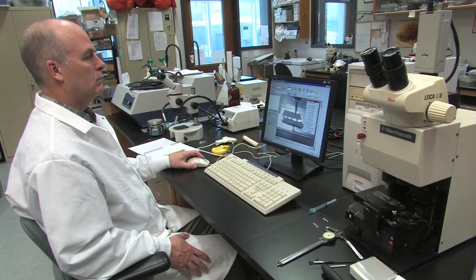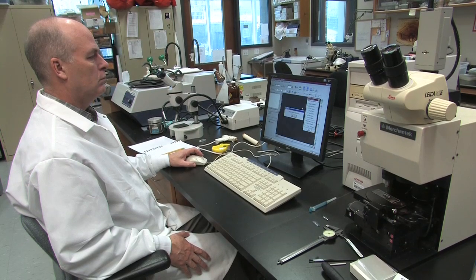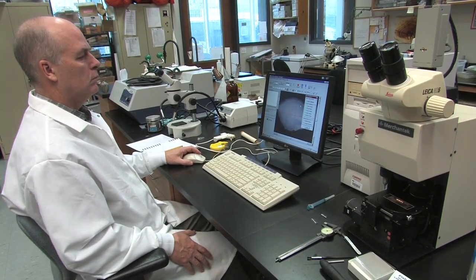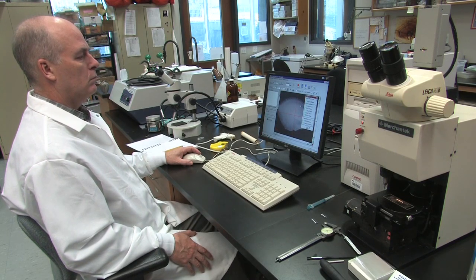The XY Offset should be calibrated correctly, but if you should notice that the drill is not drilling exactly where you want it to be during the sampling, the XY Offset may be off and will need to be reset.